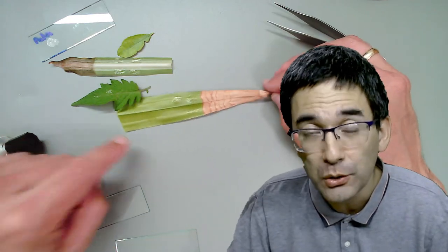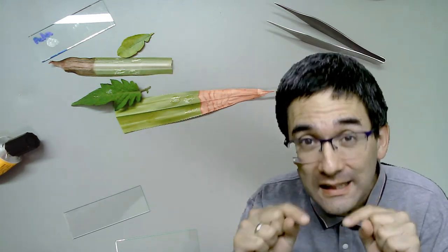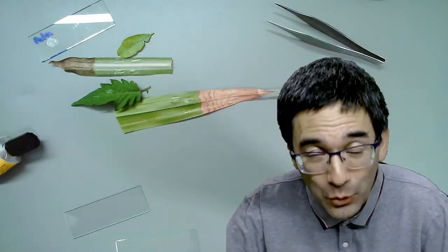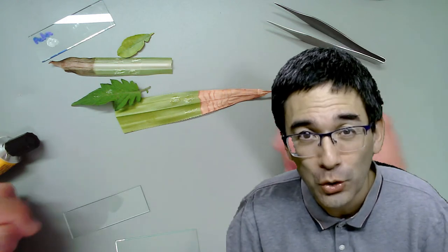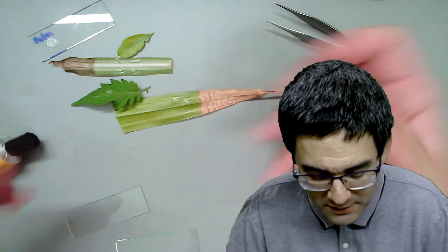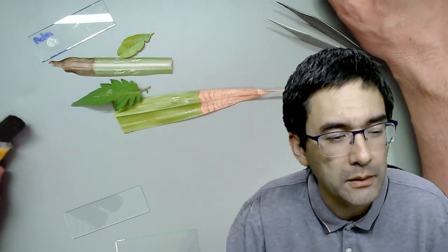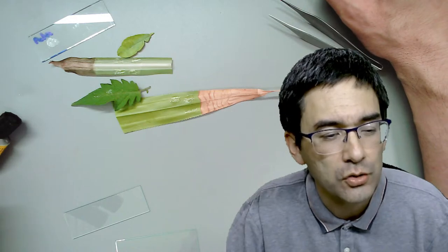When you want to get the surface of the leaf, I recommend using the bottom side because that's where the so-called stomata are. Stomata are openings in the leaf where gases like carbon dioxide can go into the leaf for photosynthesis. Those stomata are what we'd like to have a look at.